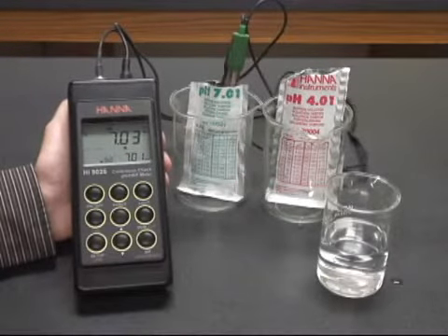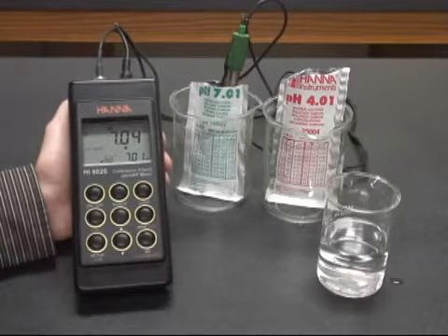Within a few seconds the meter should calibrate automatically to the 7.01 standard and ask you to confirm that standard.